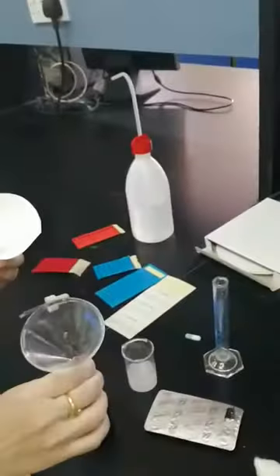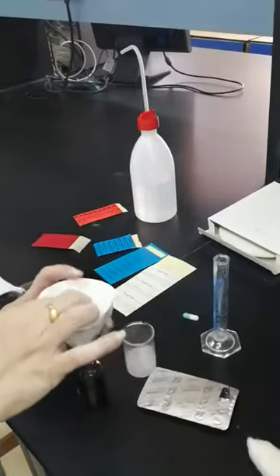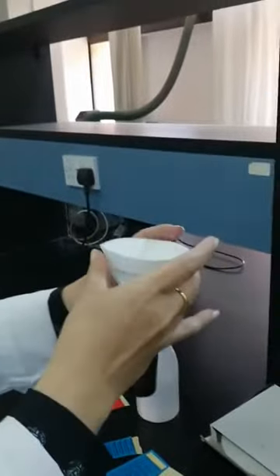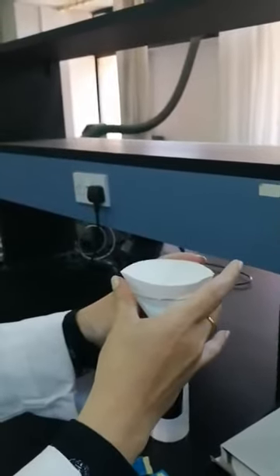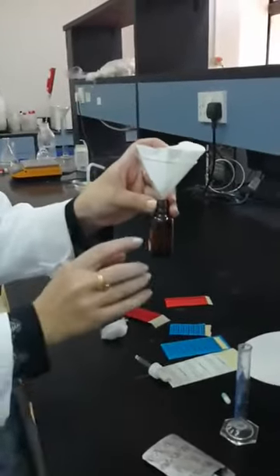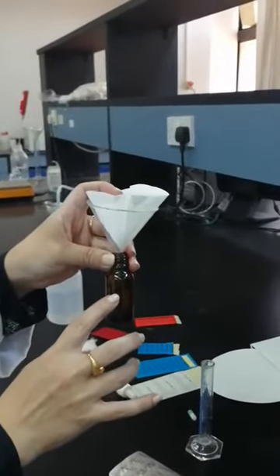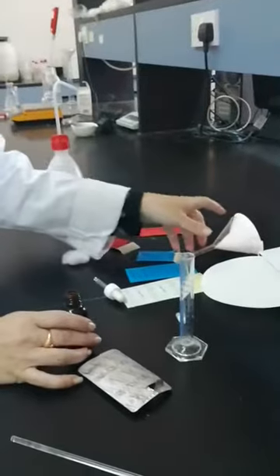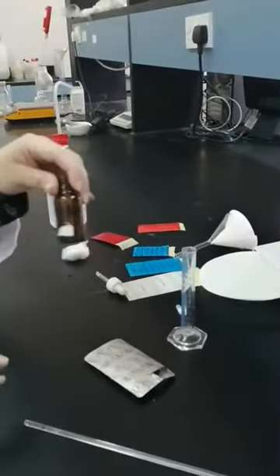As I said before, I'm going to do filtration of my suspension directly into the bottle up to the third mark, because I don't want to waste anything. By doing filtration and waiting for my sample to be filtered up to the third mark. Okay, after doing the filtration, we complete the volume up to the third mark, which is 10 ml. It's a clear solution. So after that, this is extemporaneous preparation.